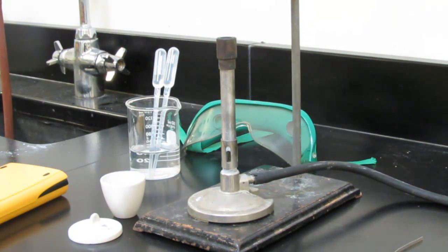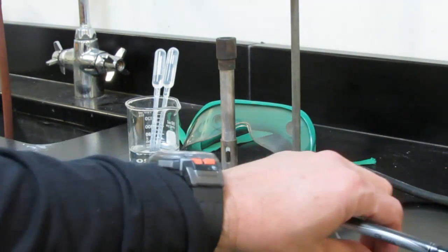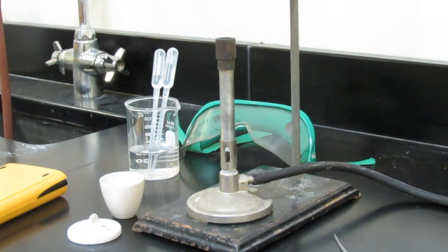Okay, welcome to the laboratory. We're going to go over our empirical formula lab today. We're going to find the empirical formula of magnesium oxide.